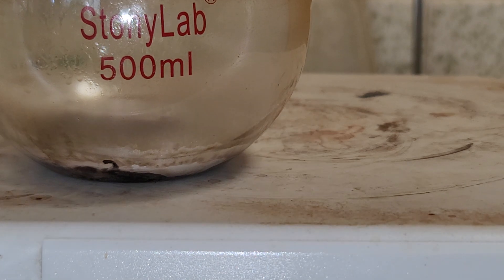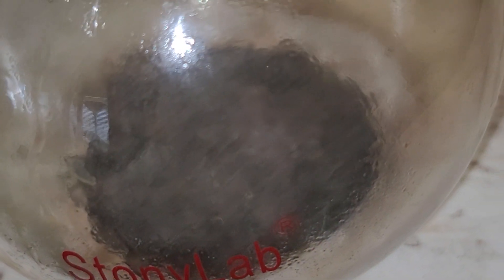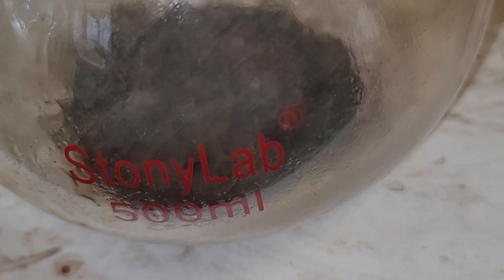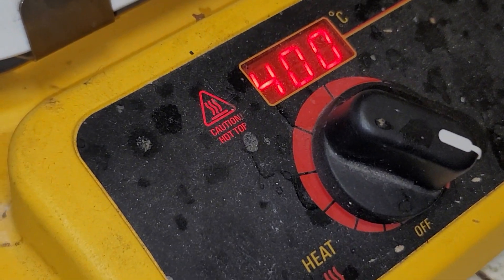This is alchemy of Stephen's school — not for consumption. The impurities are burning off more in the heat now. I see a color change in the glass; I see a little bit more gray or white in the blackness. The blackness is lightening up. We have a white fume arising at 400 degrees Celsius.